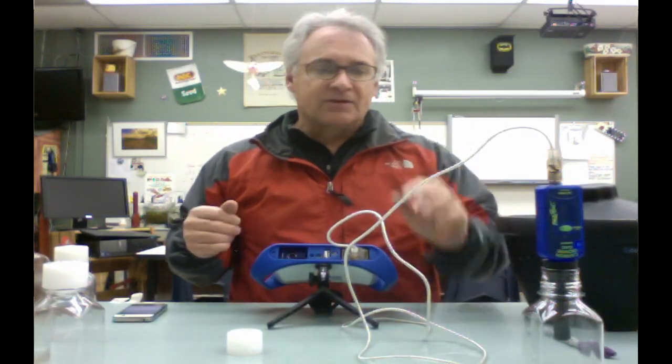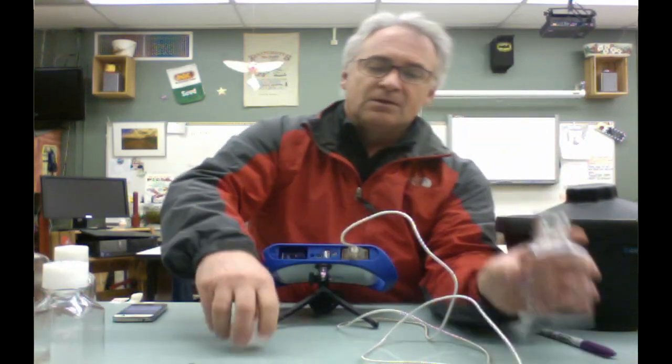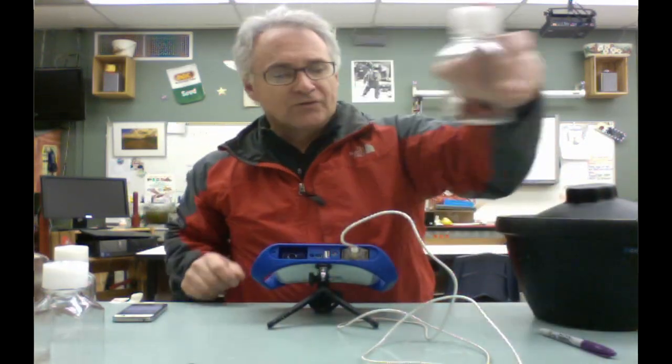So let's say the 10 minutes is up. You're going to collect the data, set this off to the side. You're going to clean that up later. You're going to rinse out the bottle, and then you can dry it, and you can use it for other things. So in this particular case, we're going to do the same thing again.